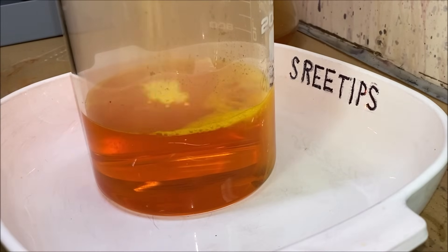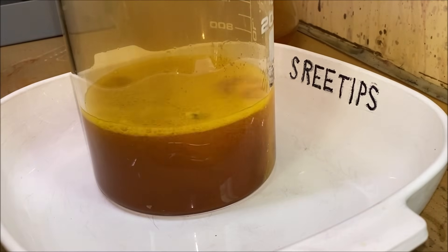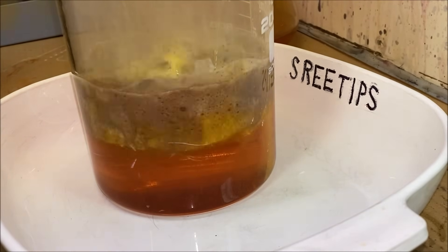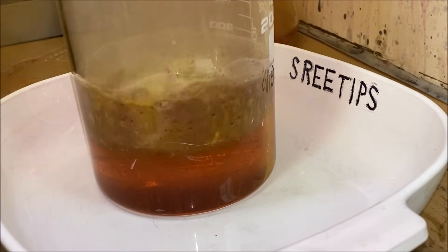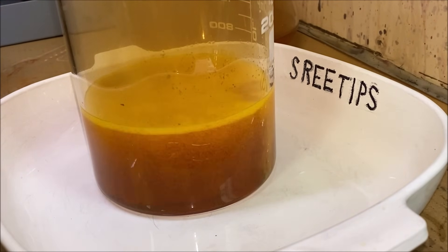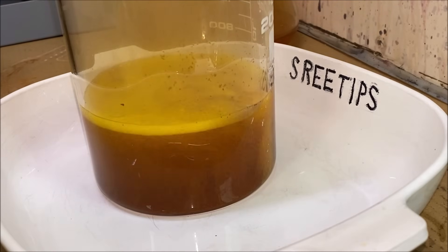This is all new to me — I just recently started boiling the solution to get it to settle, so I'm low on experience with that. You can tell this is excess nitric big time. The gold is coming out of solution and then re-dissolving just as fast as it precipitates. If I keep adding the SMB, eventually it will consume all the excess nitric and the gold will stay precipitated.